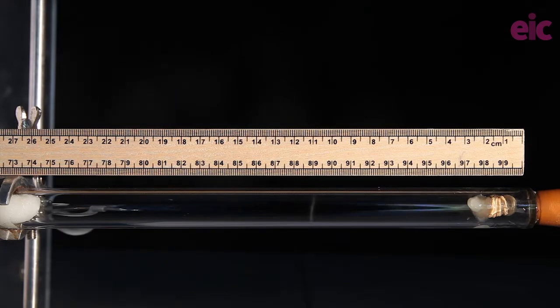Now some of the descriptions for this demonstration suggest using pretty long tubes, but actually I find something in this kind of length gives us a result in under a minute, and you can hold the class's attention for that period of time.